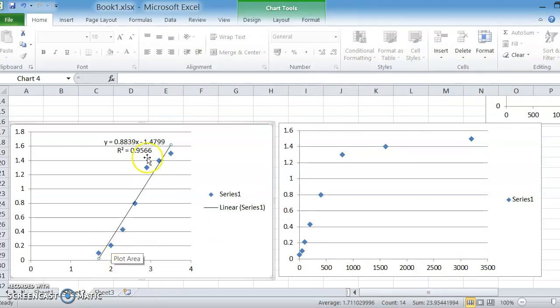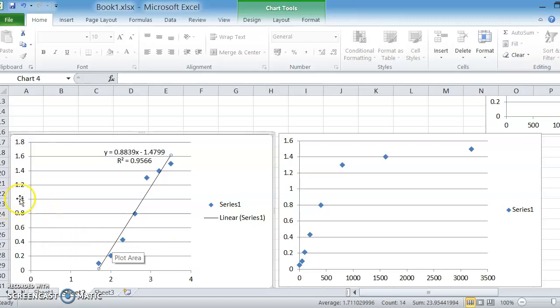And what we can see is the R squared is 0.956, which is not brilliant. If it's perfect, it would be 1. And you can see it said, okay, this is the formula for this set of data points if you're going to assume it's a straight line. And that's an assumption that you need to decide if you're going to make as a scientist. But let's say we are going to do that. What we've now got is a formula for our graph that we can read off our absorbances and find the corresponding value. So if you read off, let's say, 1.2 and it comes down to be 3, well, we're looking at the 3 being a logarithmic value, which would actually equal 1,000.